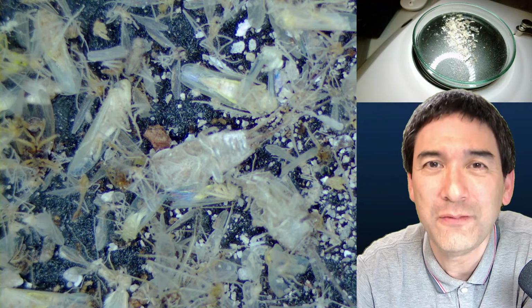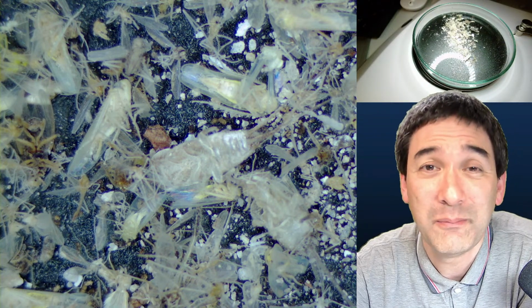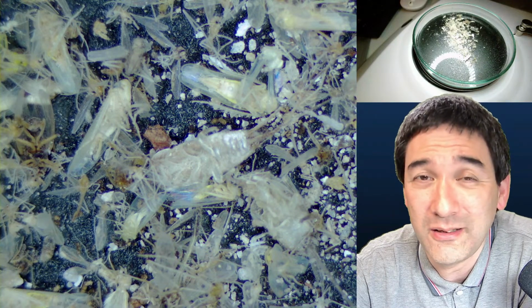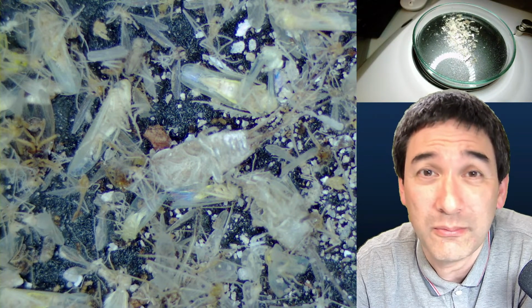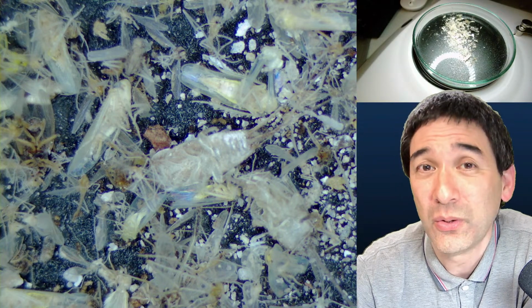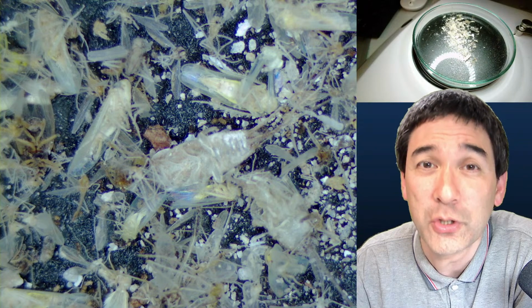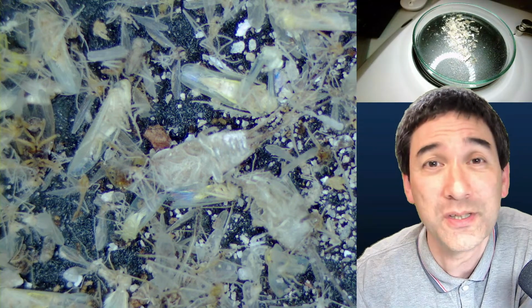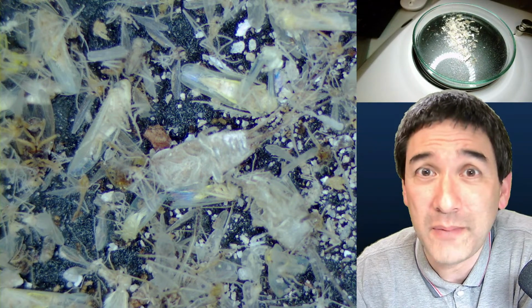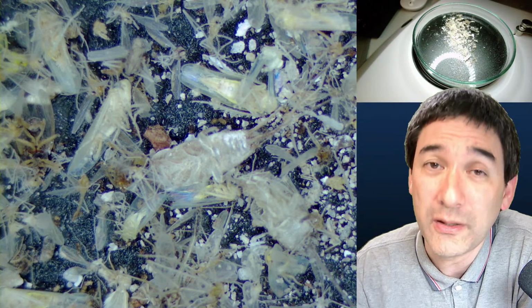So generally, if you have a microscope with a condenser and a filter holder, then you can already do quite a lot with that. So my general advice is probably not to spend too much at the beginning, especially if you don't know yet what you want. Just go with a reasonable device and then upgrade to a new microscope as you go along.